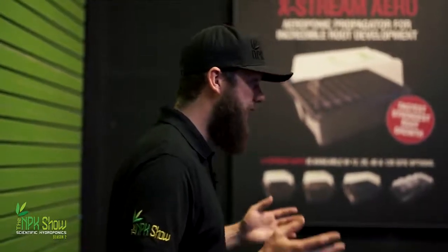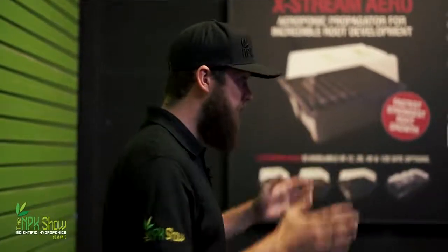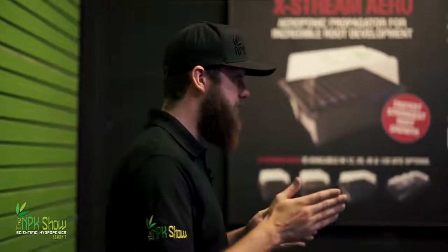But we've got EC, electrical conductivity, and it measures how much the salts conduct the electricity in your solution. And any conversions or any PPM readings are based off EC. Scientific labs around the world use EC, and it's what we choose to use at NPK. So try not to get too confused. If you do use PPM, as I walk away, we're going to leave a conversion table behind me, and you can start to see the EC or the CF or the PPM and what you should be aiming for. So we're going to get behind the desk with Barry and show you how to calibrate and clean, the important part of looking after your hardware.